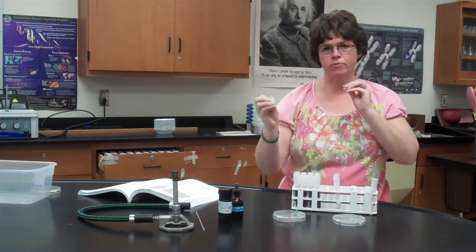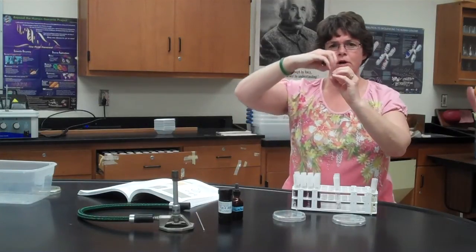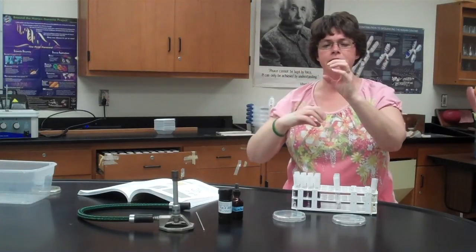The other thing that you're going to look at is how they divide. So yeast basically divide in two different ways. One is they divide by budding. And budding is where a cell will have a small outgrowth and then that outgrowth will pop off, okay? So what you'll see is a larger cell with a small one coming off of it, or you might see the larger one with the smaller one already off. It's not going to be symmetrical, okay?